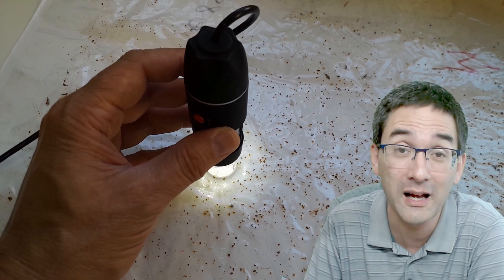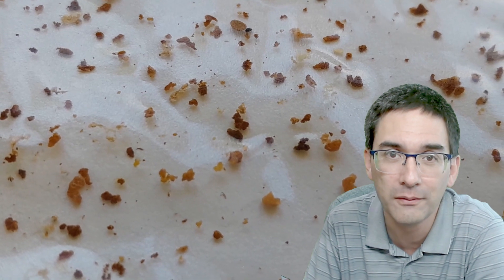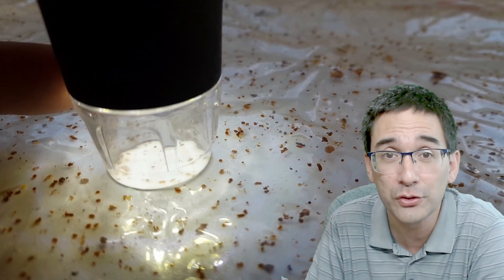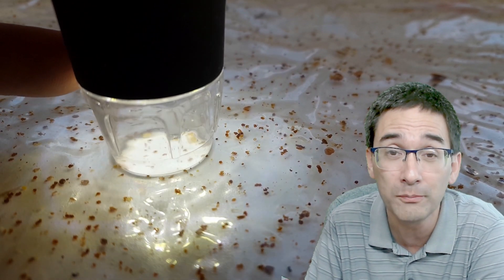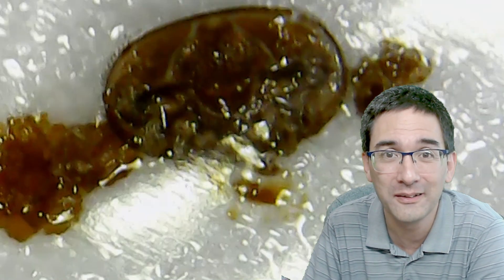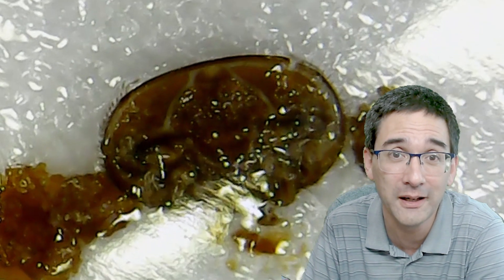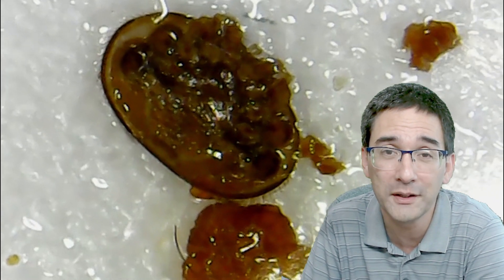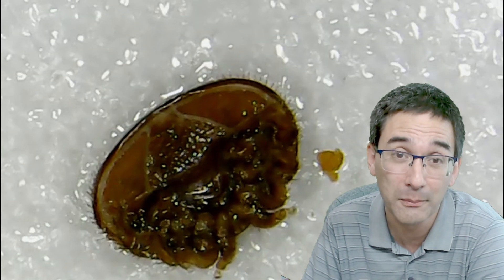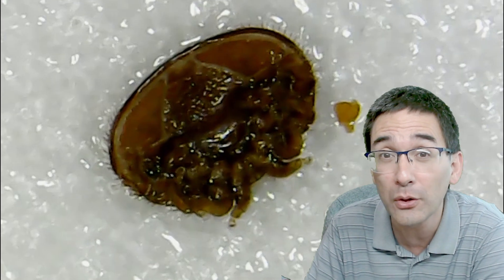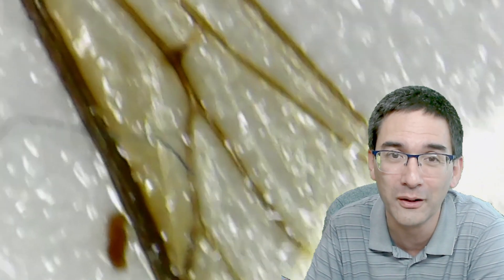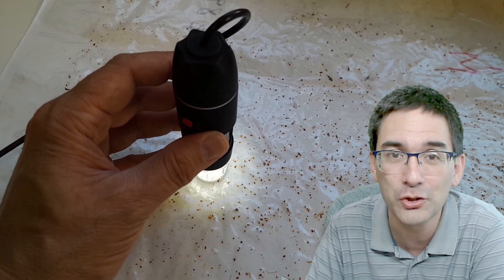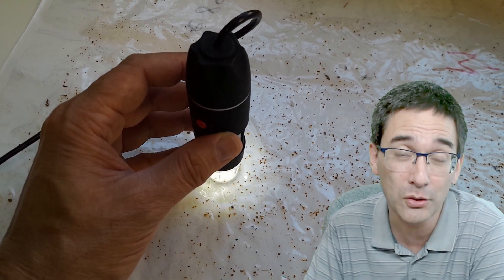Of course I also wanted to use my little handheld microscope to do a first assessment here. This is a USB microscope, actually a little bit like a camera with a lens in front. When you actually use this handheld microscope, you see the magnification is quite a bit larger. It's nice to have a built-in LED for proper lighting, and this is basically one of those mites. Look, it's quite magnified. Because of the plastic foil there are a few reflections which might be disturbing, but it's possible to see those mites are quite abundant here. They're already all dead - maybe they die off, or as I'm going to show you later, sometimes bees are able to kill them by biting off their legs. I've also found a wing of a bee on this plastic foil. I decided I want slightly better quality images.